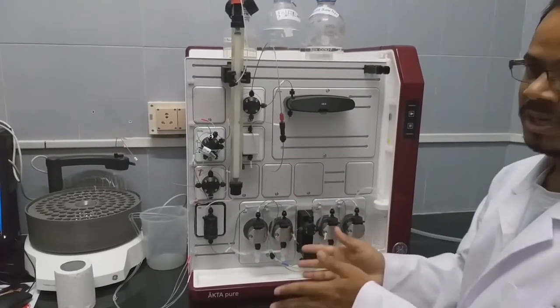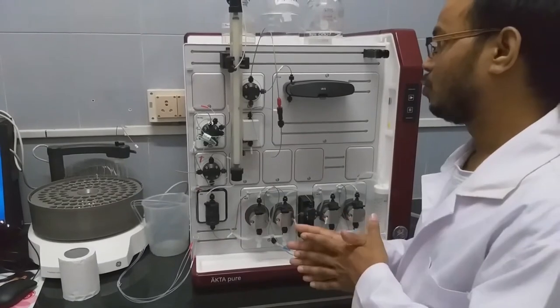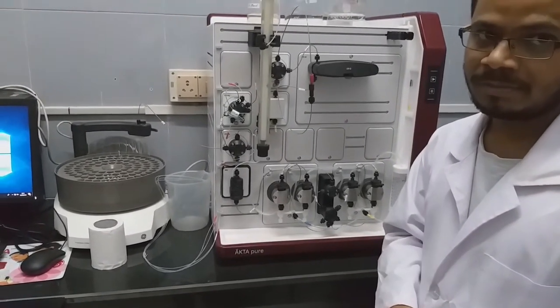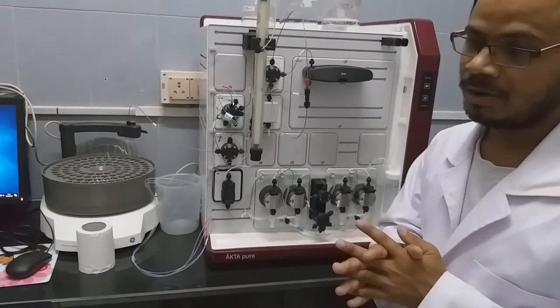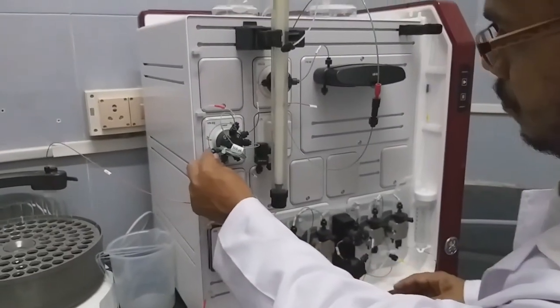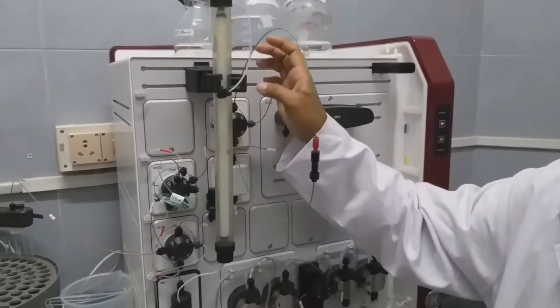Once the pressure is monitored, the flow will go to the mixer. This is the mixer where two different buffers can be mixed. For example, if you are purifying using a nickel NTA column, you need an imidazole buffer and an equilibration buffer separately. To elute the His-tagged protein, you have to mix both buffers A and B here. Once mixing is done, it goes directly to the inlet loop, and from there to the chamber where it connects to the column.